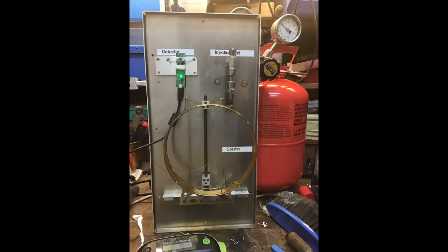This gas chromatograph is a little less homemade and a little bit more professional than the other one I built. It can be used to analyze higher boiling analytes, like the usual lab solutions such as acetone, cyclohexane. As you can see in the picture, there's a real capillary column. It's a PEG Carbowax capillary column which I found at my university, and the pipe connections are also from there. The only new parts of the GC are the carrier gas and the semiconductor gas sensor.